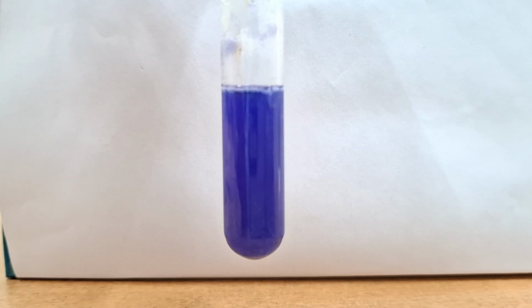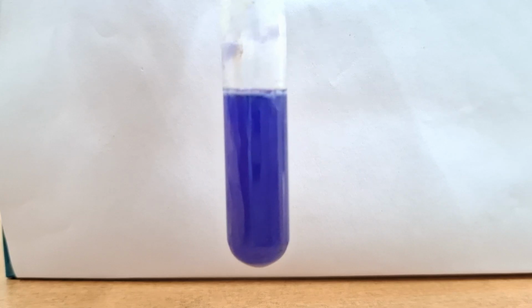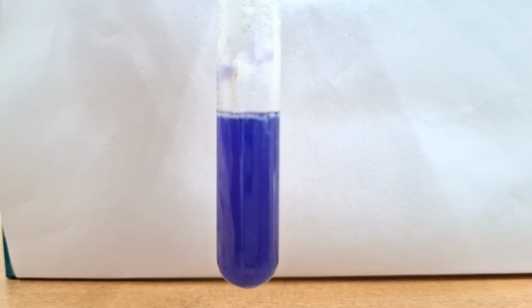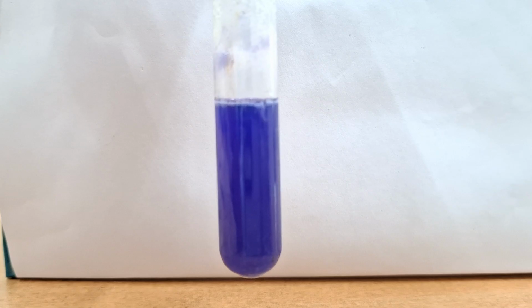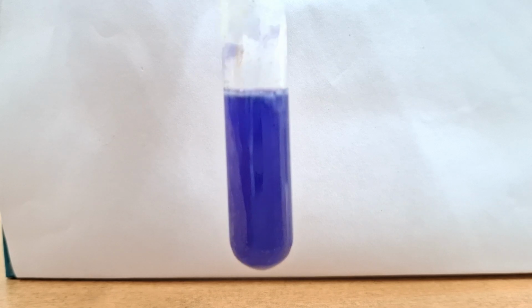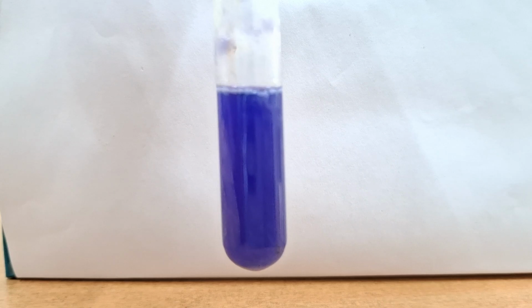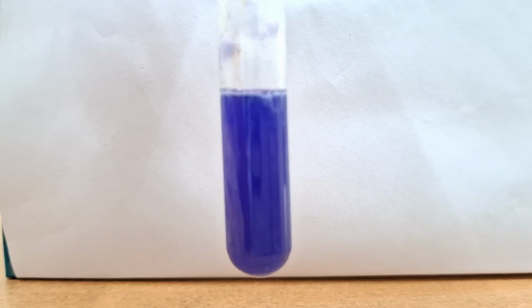The reduced ninhydrin, called hydrindantin, then reacts with this ammonia and another molecule of ninhydrin to produce a bluish coordination complex. As a result, a lavender color develops. Okay, you will be asked this question in your viva: why will ninhydrin show this purplish blue or bluish purple color? Okay, I hope this is clear. The inference will be that free alpha amino acid is present.